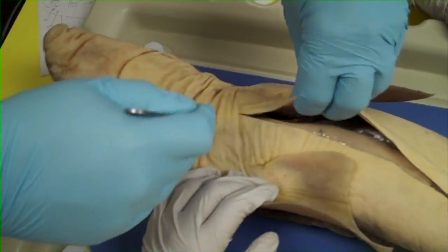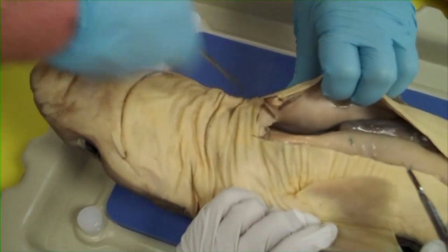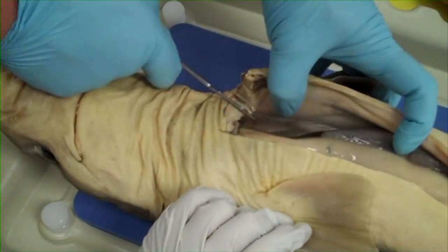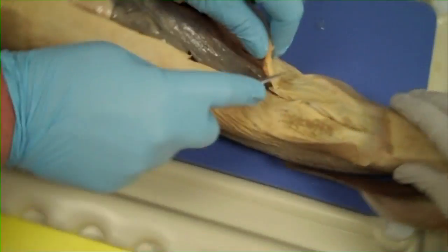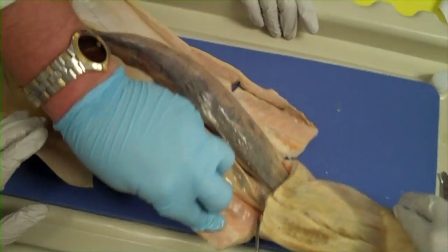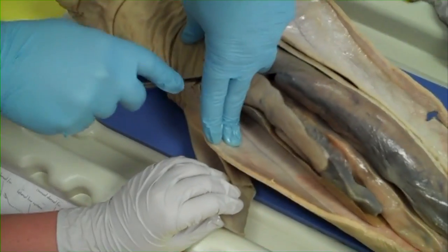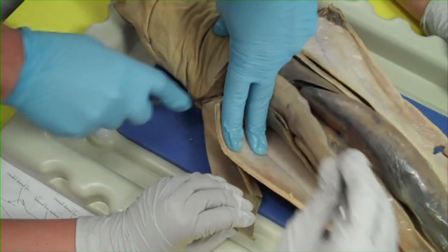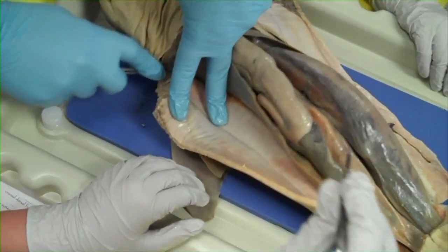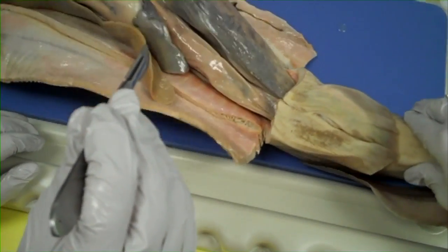I'm going quick — he's a professional. I've dissected probably 500 to 1,000 sharks over the years. This blade has gone through a lot of shark skin. It's the same one I've been using since the beginning, but the blade does get duller over time. When you're cutting through the bigger ones, there's a lot of cartilage too.